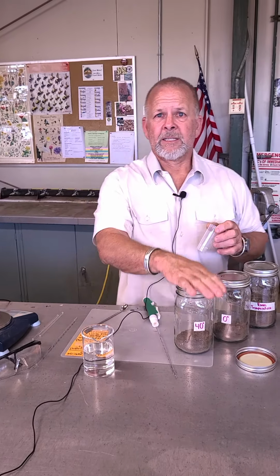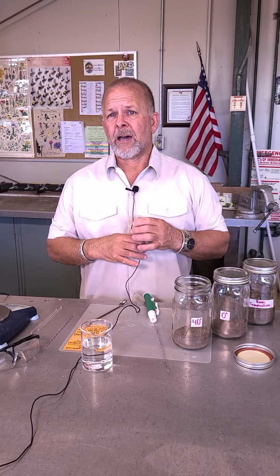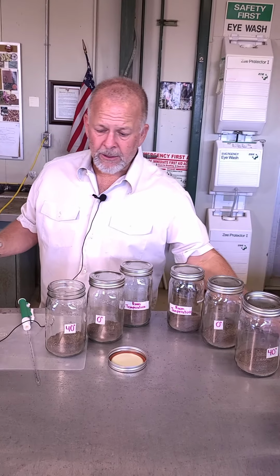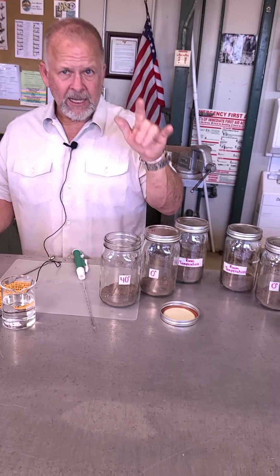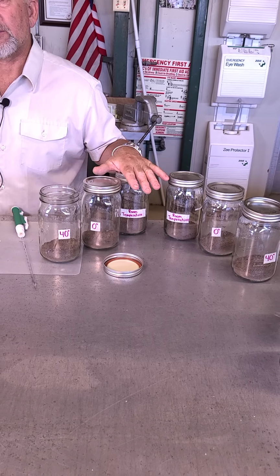Now, it's not just something that we're doing in the lab, but we can translate the results out into the larger world. Okay, so what we've done here, just to catch you guys up, and I need to go back to this, is that what we're going to measure is we know there's going to be some respiration.